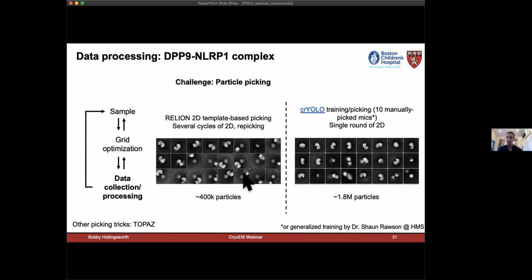In terms of data processing, that was the last hurdle for us. And I won't talk too much about the 3D classification schemes. Humayun did a fantastic job processing the data set at a later stage. However, we also encountered issues with particle picking. For our 2D-based picking in Relion, despite everything we tried, it seemed like we were getting a little bit of our picks off-centered. We weren't recovering an amazing amount of particles from a data set of about 6,000 micrographs. However, when we trained a crYOLO model, I manually picked 10 micrographs for this. After a single round of classification, we were having 1.8 million particles with beautiful alignment.